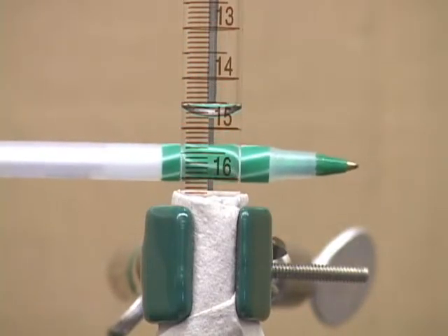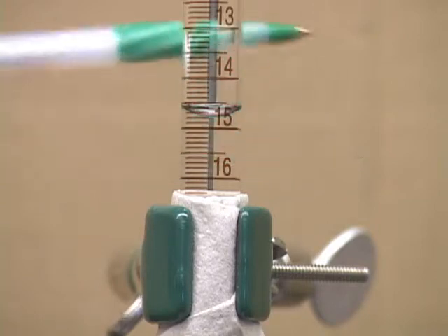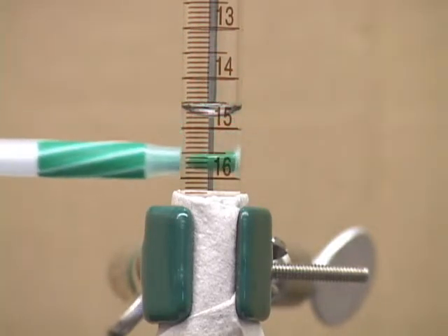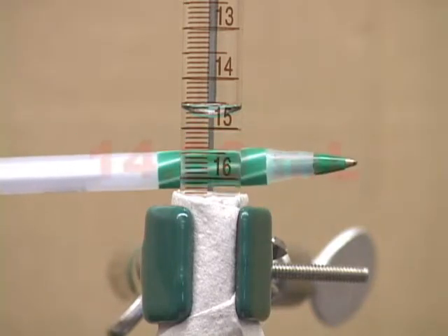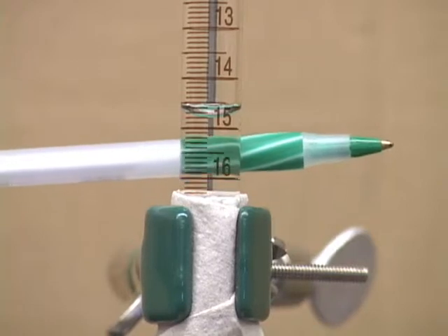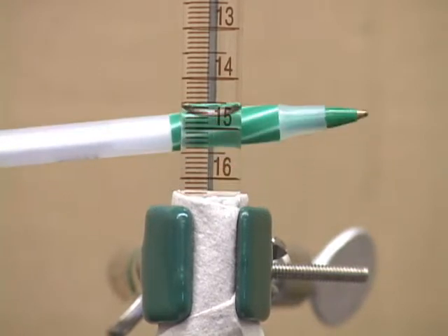Here's the final reading on the burette, and as you can read, it reads down, remember, 14, 14.5, 6, 7, 14.80. And as you notice, the meniscus will change a little bit as the background color changes here.